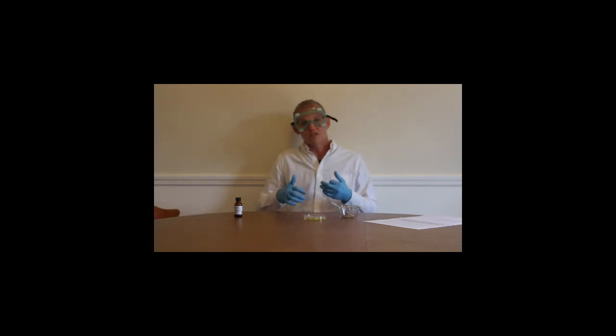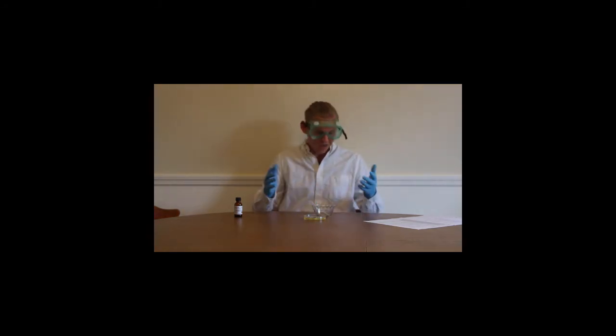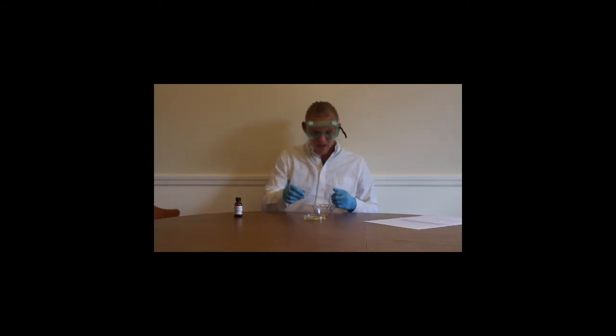So I have this petri dish of the cooked egg. I can dispose of this in a sink, but since the materials are more solid now, I would probably want to use a garbage disposal or a toilet that can handle those more solid materials. I can wash out my original dish that just had the egg whites in it with soap and water, and then my pipette, this is a cheap plastic disposable pipette, and I can dispose of that properly in a chemical waste bin since it's been contaminated with that sulfuric acid.